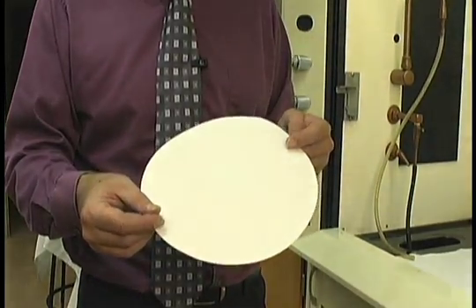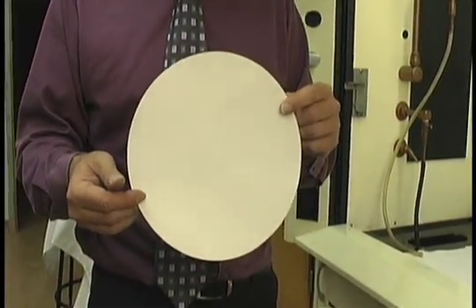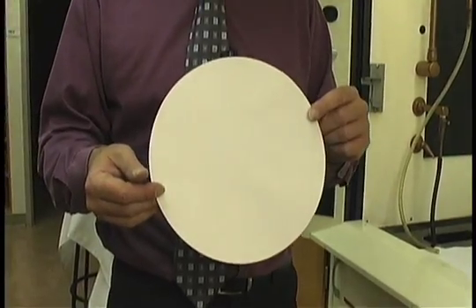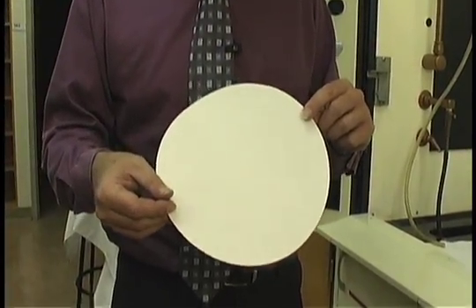Fluted filter paper is necessary for gravity filtrations because it gives a much larger surface area for the liquid to pass through.